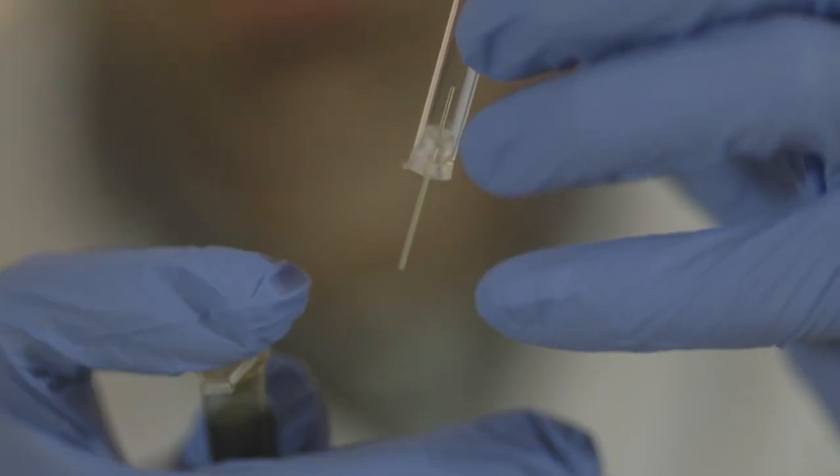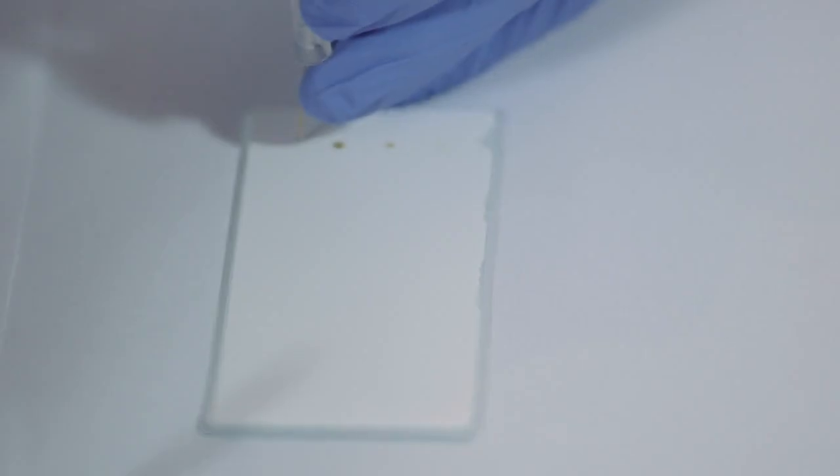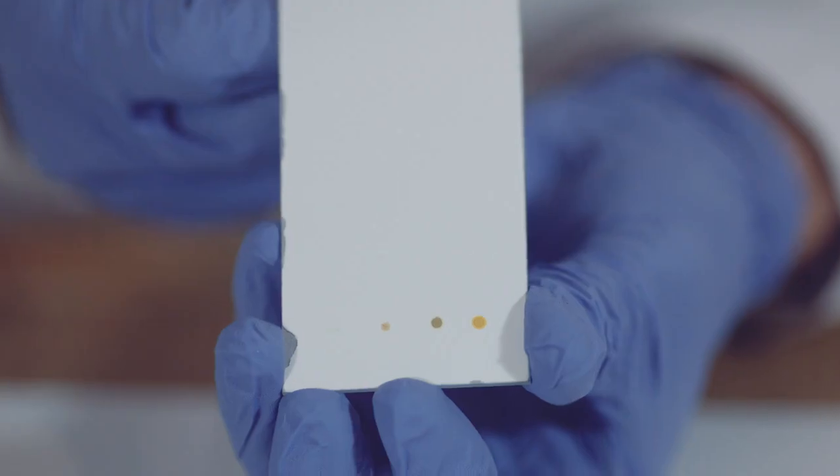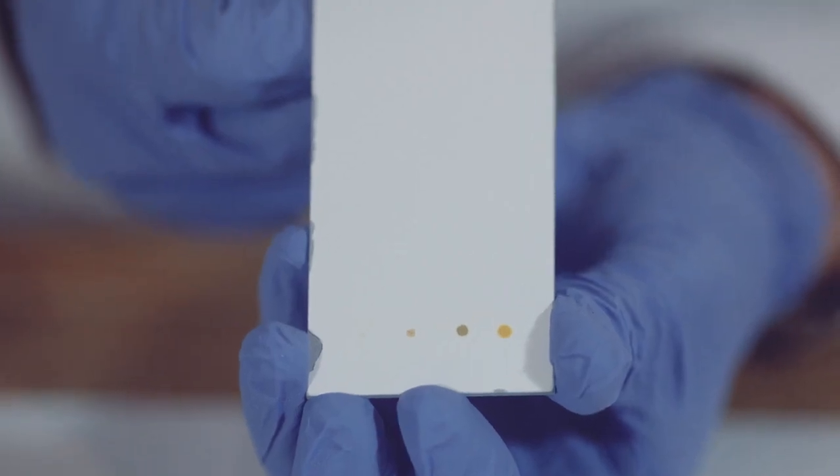You are now ready to apply it on the marked spot of the test plate by letting the lower end touch the coated white front. The fluid will be released on the plate's marked spot.